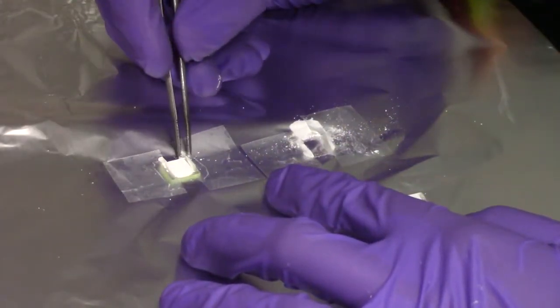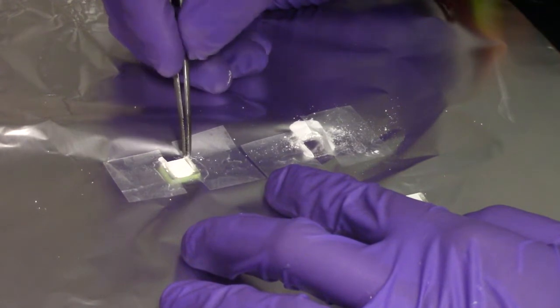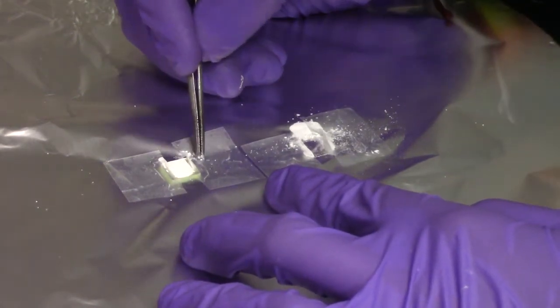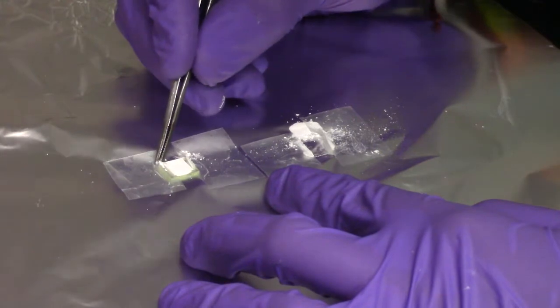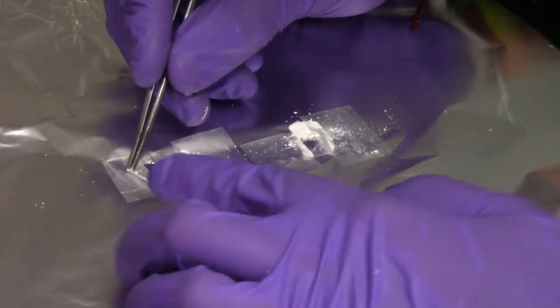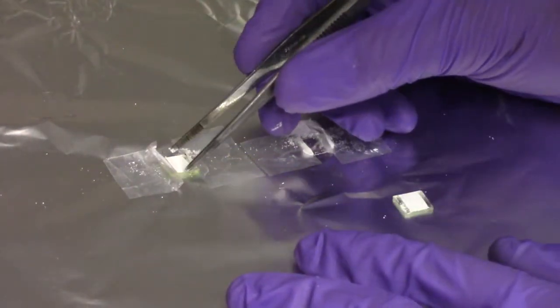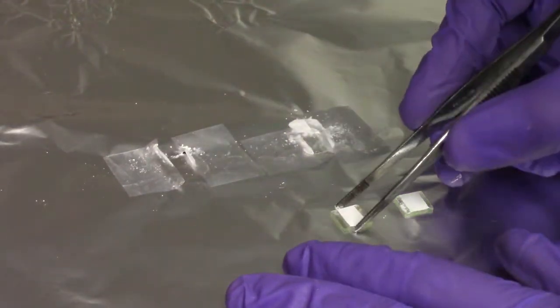After removing the tape from the anodes, they are ready for the heating process.